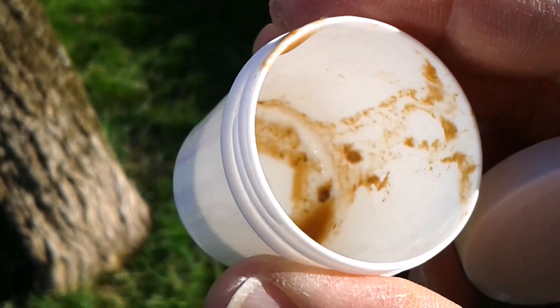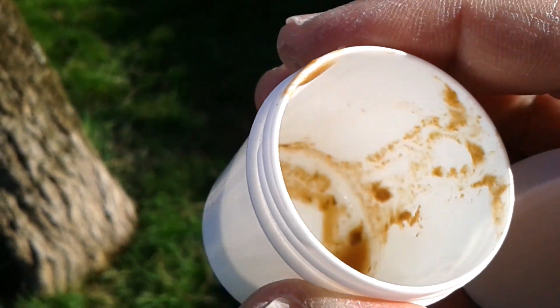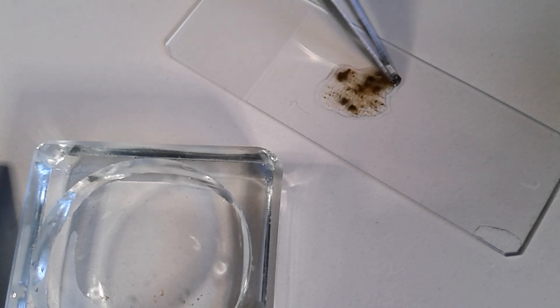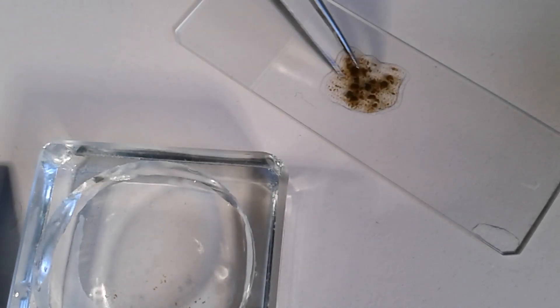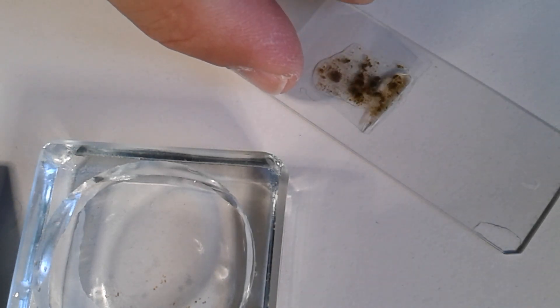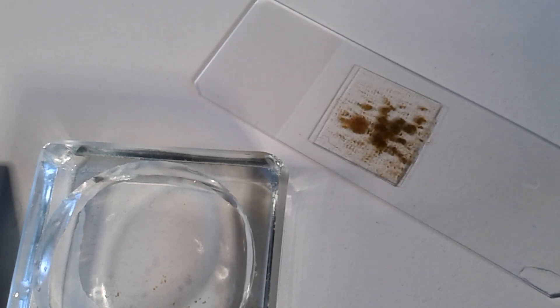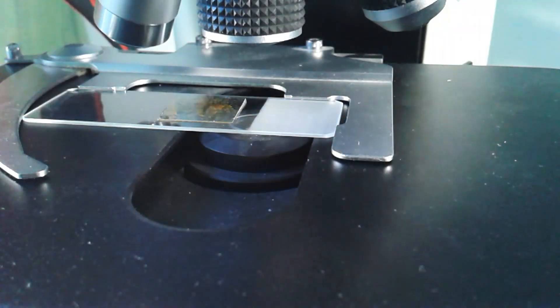This is the other sample — not very appetizing, I understand, but surely quite interesting. A slide preparation is pretty easy, self-explanatory and straightforward. All you do is take some of the sample material and spread it on the microscope slide, put a cover glass on top as always, and that's pretty much it. Then it goes under the microscope and we can start observing.